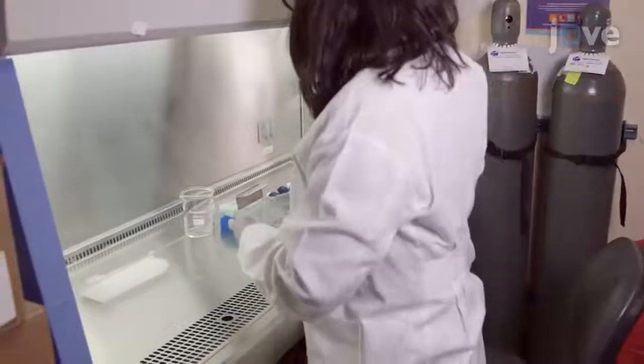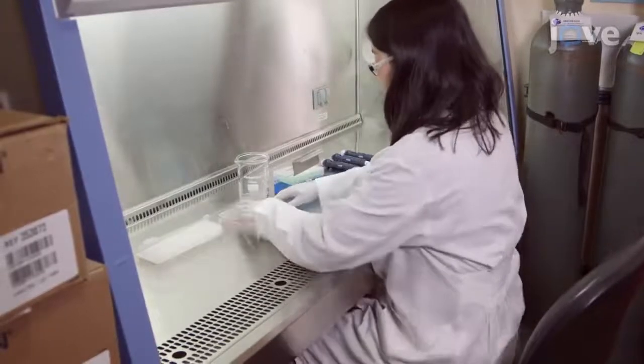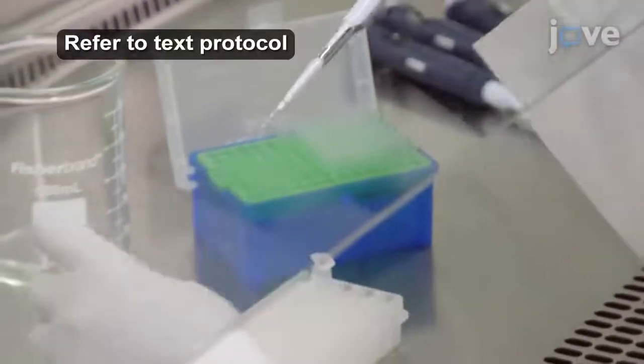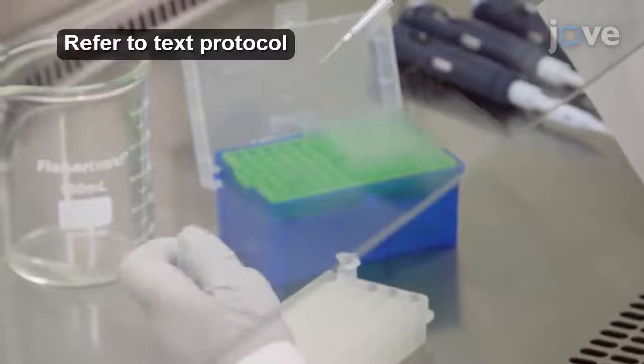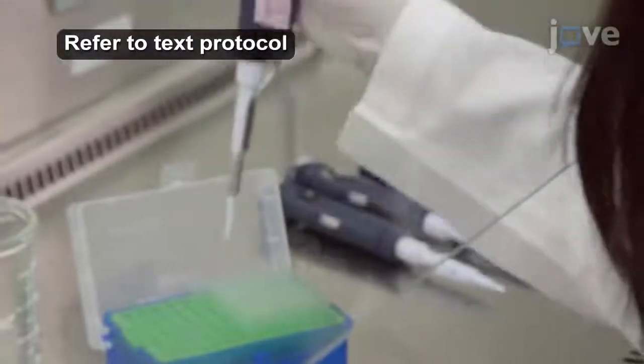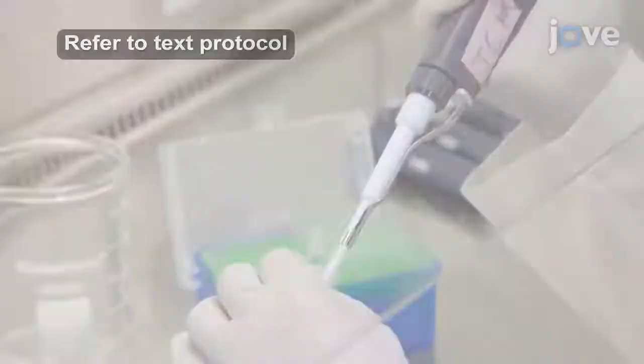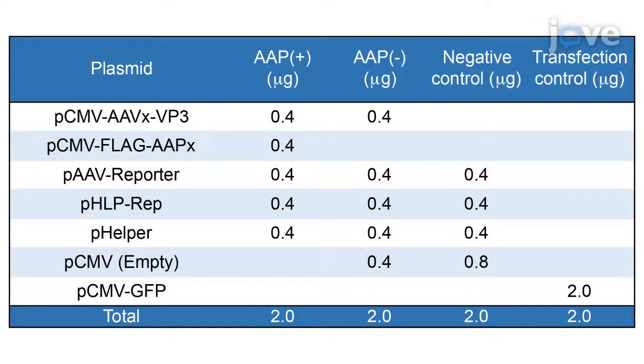On day 0 after culturing HEK293 cells to 90% confluency, prepare the transfection reagent by mixing the plasmids in 96 microliters of PBS without calcium or magnesium in sterile 1.5 milliliter microcentrifuge tubes. As indicated in this table, the total amount of DNA is 2 micrograms per well.